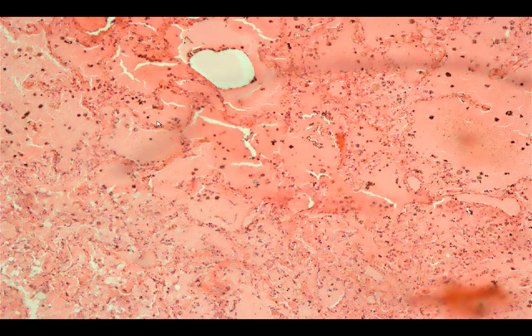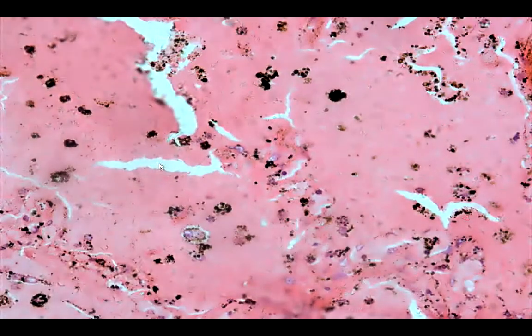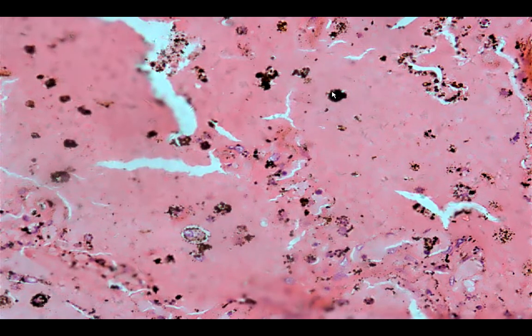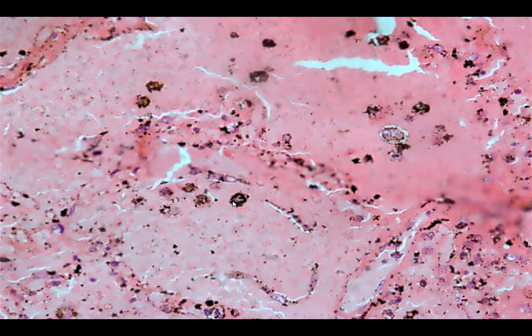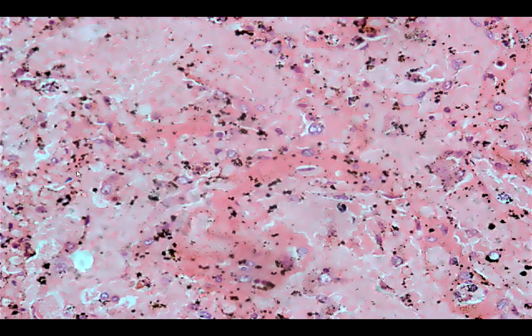To appreciate it better, you see these spaces — these are the alveolar spaces, and then these thin structures are the alveolar walls or the interstitium. Within the alveolar spaces, you can see the presence of fibrin, which is colored pink. These are hemosiderin-laden macrophages — hemosiderophages. In this case, not only would the hemosiderin be present in the macrophage, but also the anthracotic pigments. So the brown represents the hemosiderin and the black represents the carbon. You can see the presence of fibrin and histiocytes in the other areas.